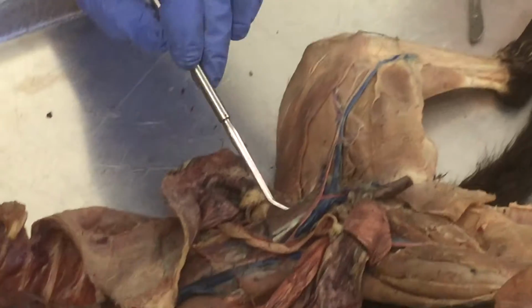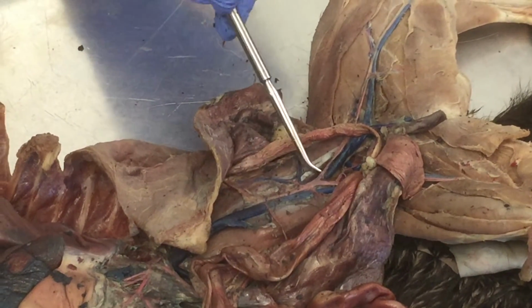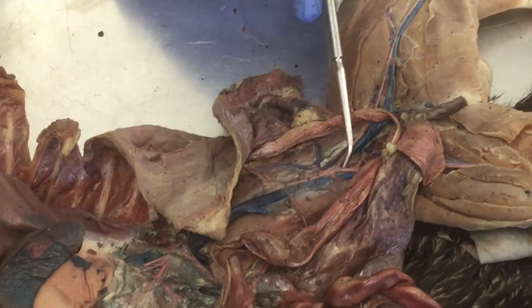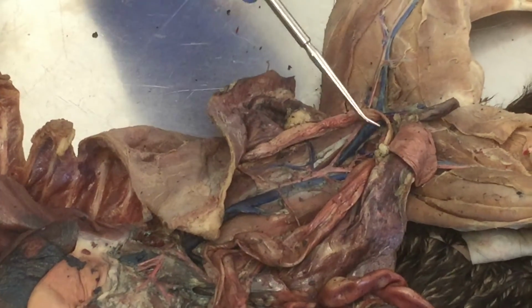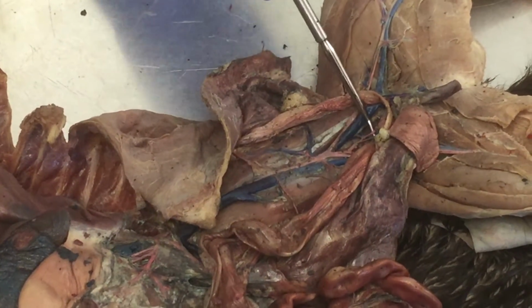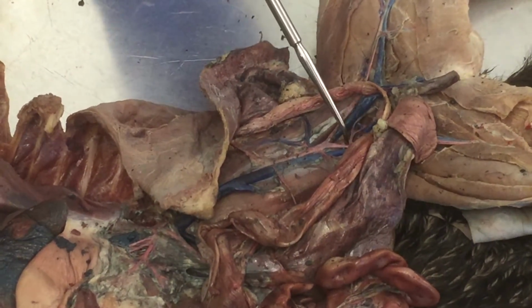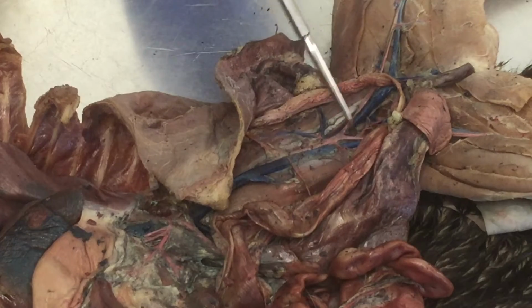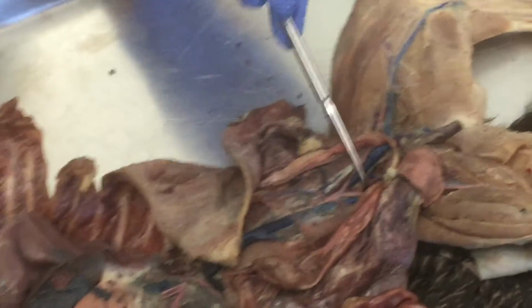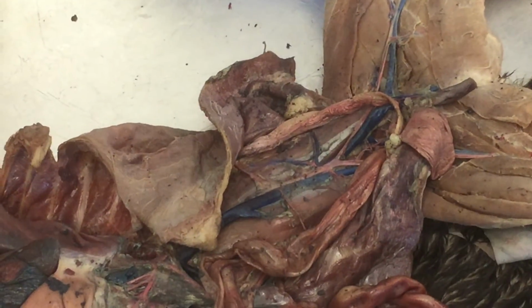Okay. Now for the arterial side, we have abdominal aorta. First branching is called what? External iliac. Okay, then you have a bridge, and then it becomes internal iliac, left and right, and then going straight down the middle, median sacral. Now in my cat, it's not beautifully middle, but it should come straight off the middle typically. It's kind of hard to see. Actually it does, it's right there. So you can see them going straight down the middle. This is not part of it. It's right here. So that's median sacral.